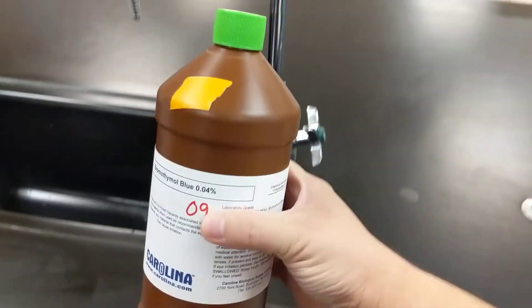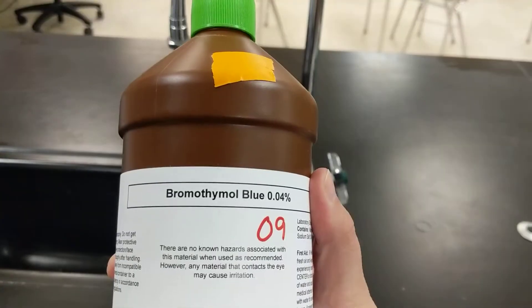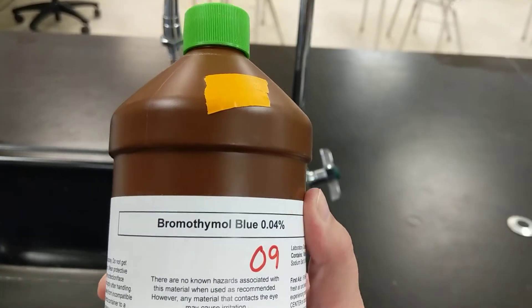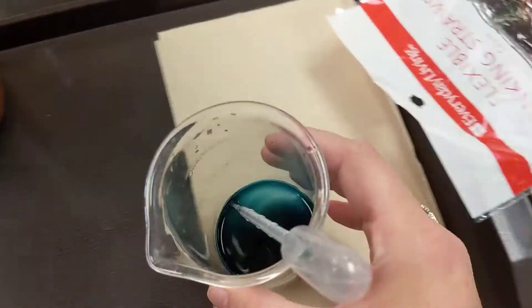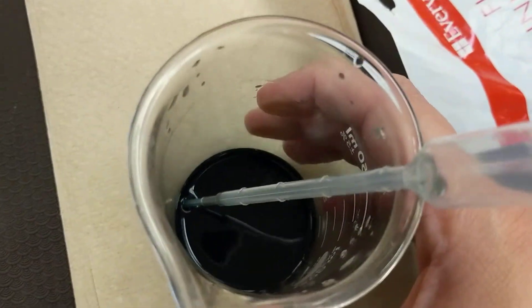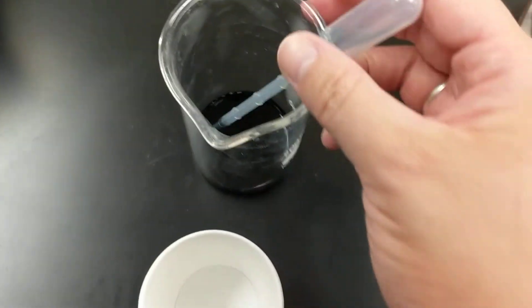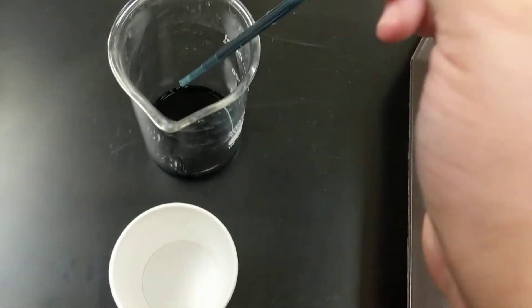We are going to use an indicator. This is called bromothymol blue, or normally we abbreviate it BTB. It is this kind of very dark blue, dark green color. That's BTB in the beaker right there. It's an indicator because it actually changes color in the presence of carbon dioxide.